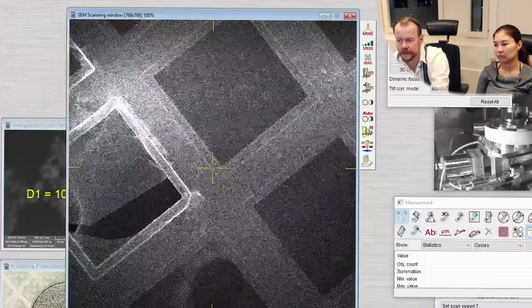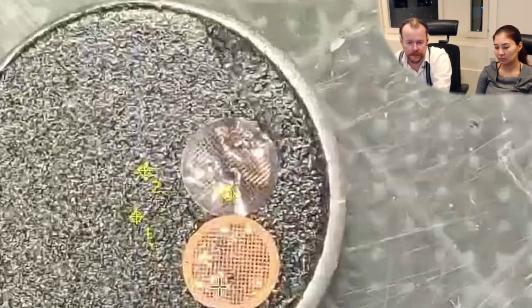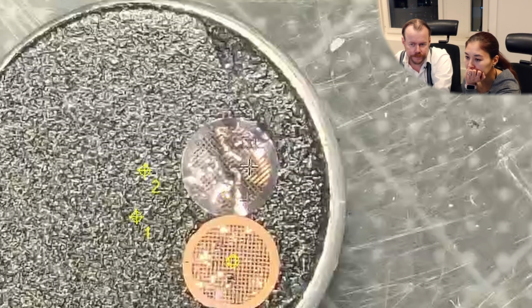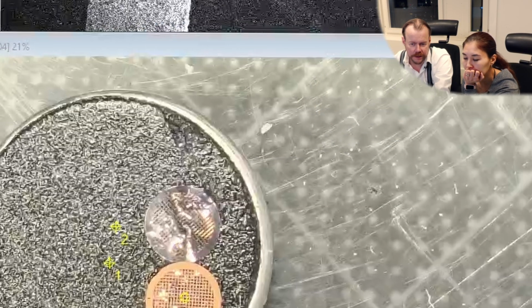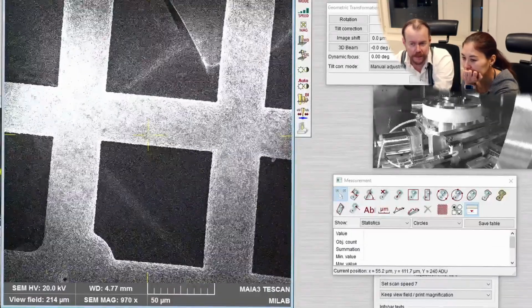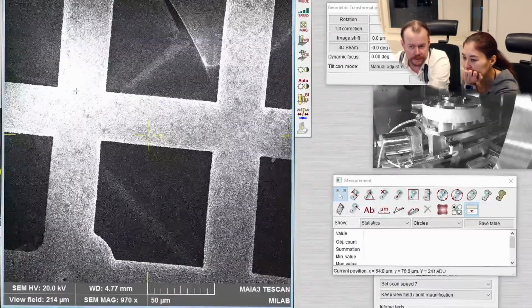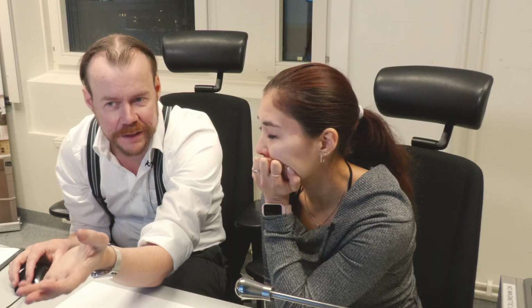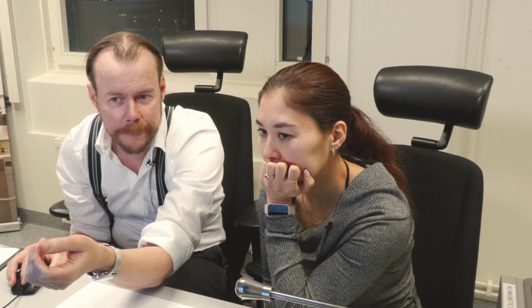So let's go over now to this other grid. We can use the map perhaps. Here we want to go to this one. So now we are on the copper grid that's flipped back side up. You see the bars is brighter because the carbon film is underneath now. So now we want to see if we can find particles around here also.